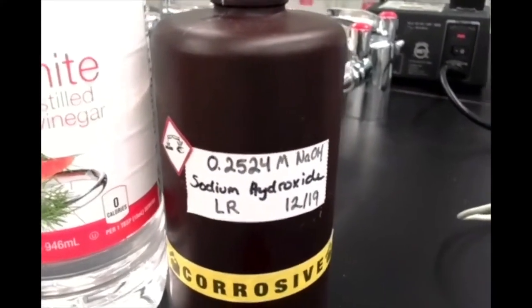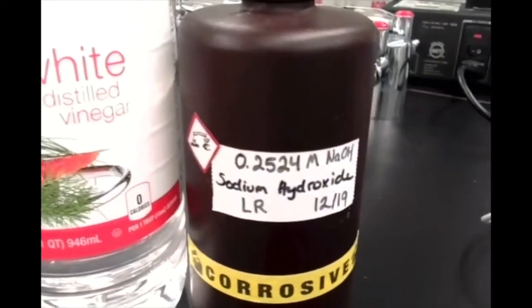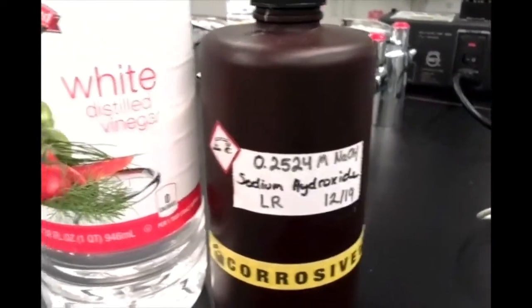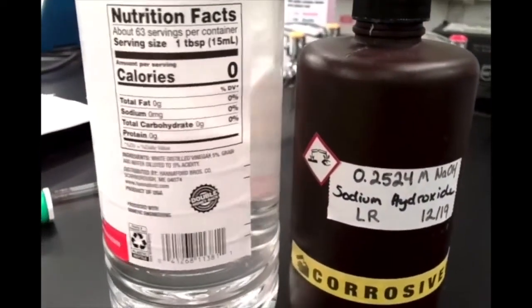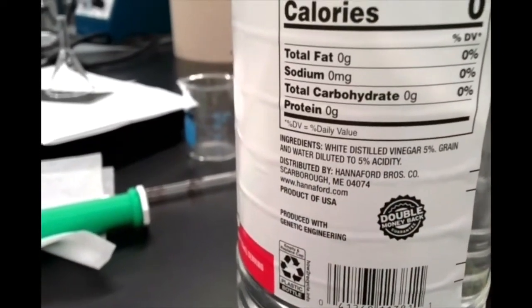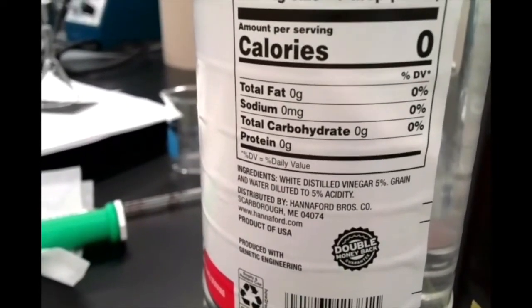Now, in this lab, we're going to figure out both the molarity of our acetic acid in vinegar, as well as the percentage mass per volume, or mass volume percentage. If we want to, get a little spoiler here, you can see that this is actually labeled on the bottle. So you can see that this is actually 5% vinegar, or 5% acetic acid in the vinegar, rather.